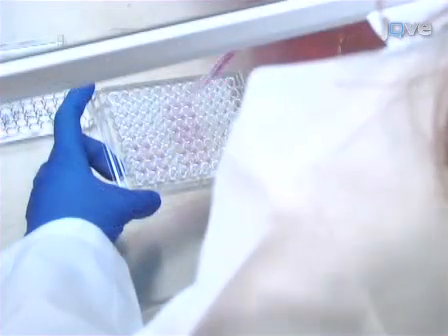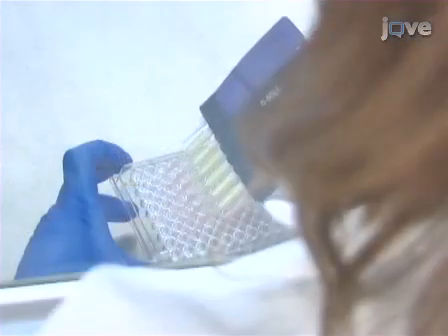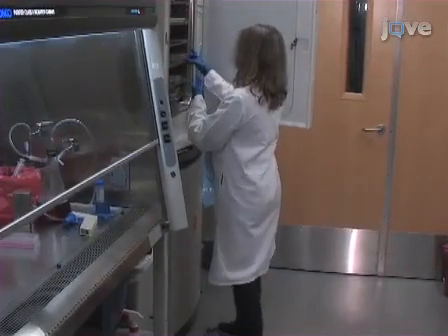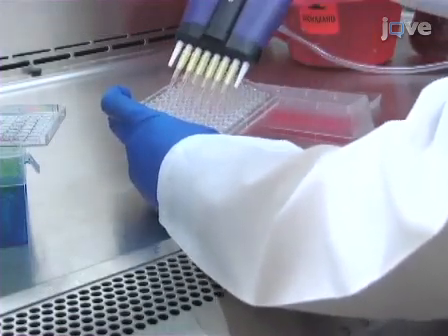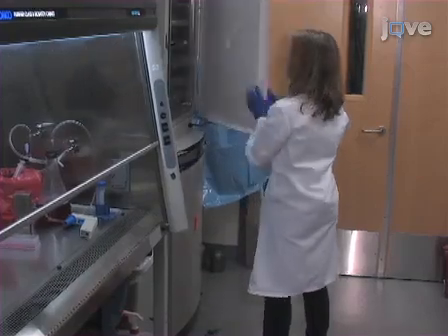Following the incubation, aspirate the media from the wells of the 96-well plate and then add the virus chondroitin sulfate polybrene mixture to the wells as planned. Also pipette control and serum-free media into the appropriate wells. Repeat the process for the 24-well plate. Incubate overnight in the tissue culture incubator. Next, aspirate the virus-containing media from the plates and replace with fresh medium. Return the plates to the incubator for a further 48 hours.